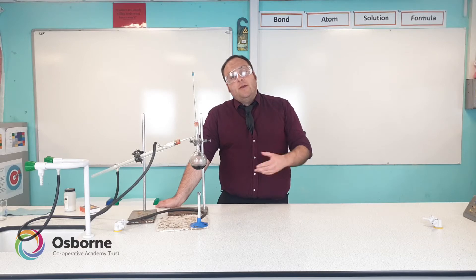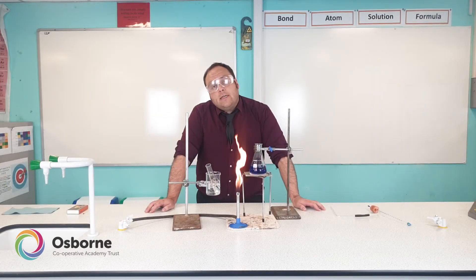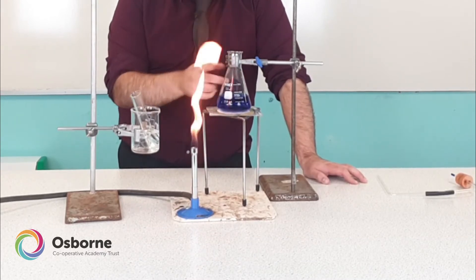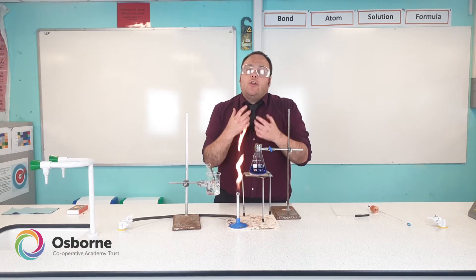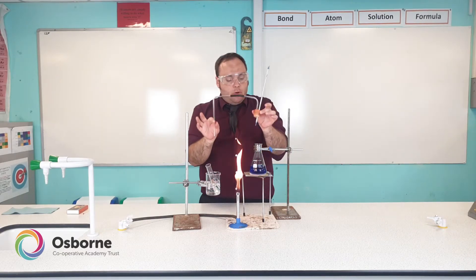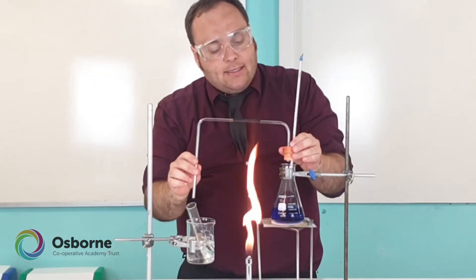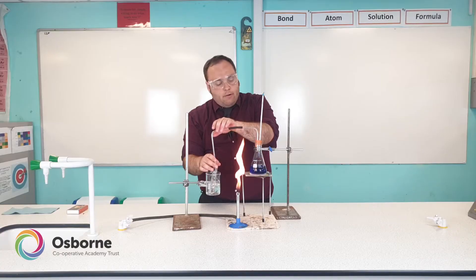For the Core Practical we don't use a round bottom flask and we don't use a Liebig condenser. The still you will use will have an ink and water mixture with some anti-bumping granules in a conical flask, on a gauze and tripod. For extra safety the conical flask will be clamped, and then a bung with a thermometer and a delivery tube is inserted. Instead of a condenser, the delivery tube feeds into a boiling tube sitting in an ice bath, which acts as our condenser.